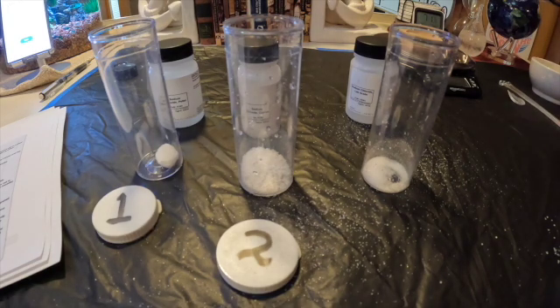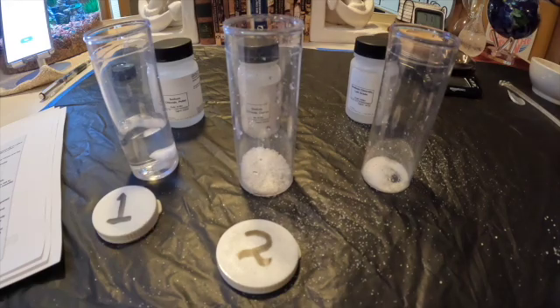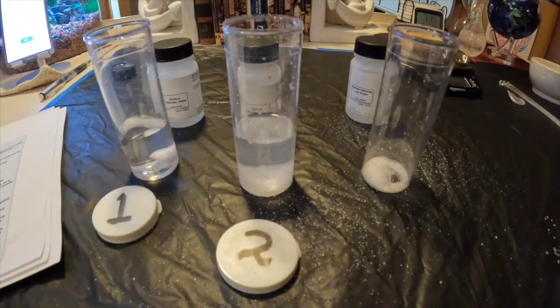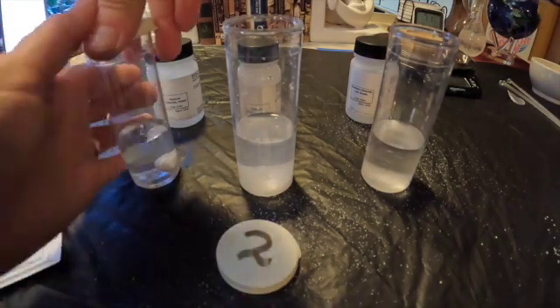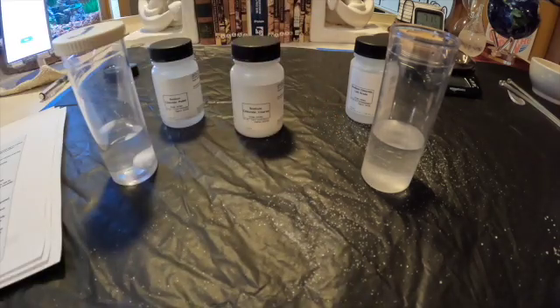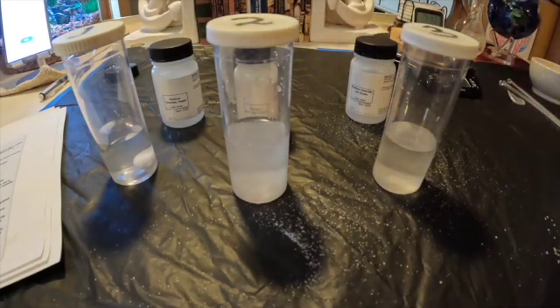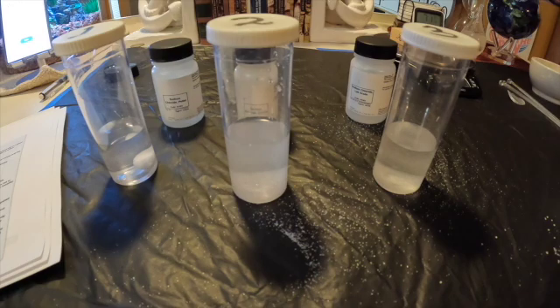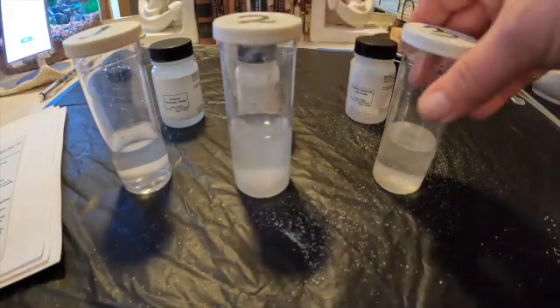Now we're going to add the 20 milliliters of water to each one. Our goal is to measure and record the length of time it takes for the salt to dissolve completely in each vial. I am going to agitate the vials, and we're going to revisit this in two minutes to begin with.